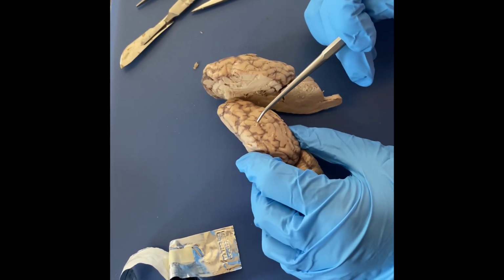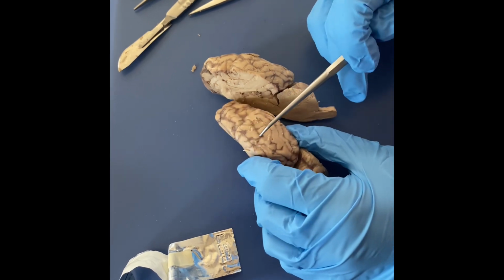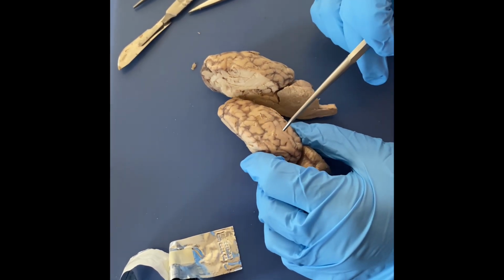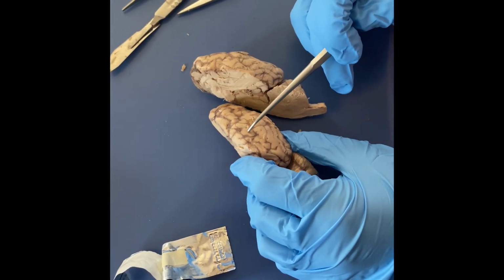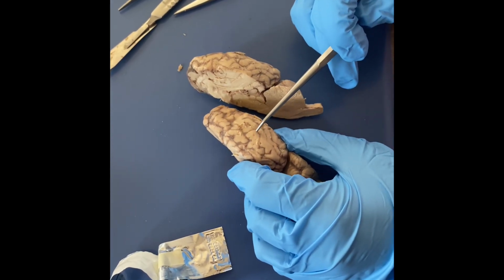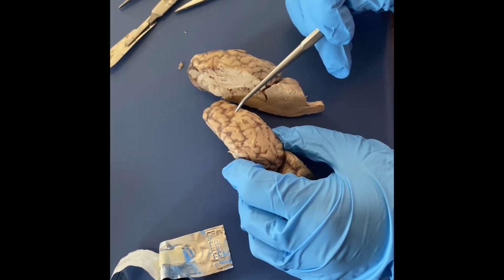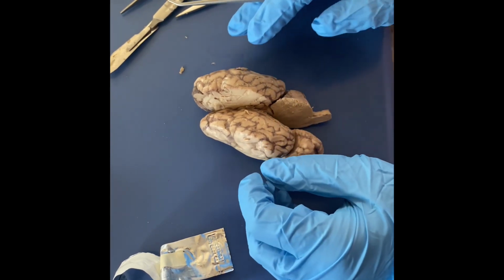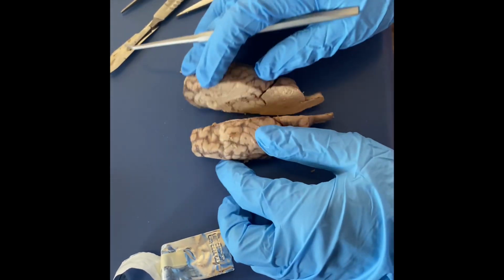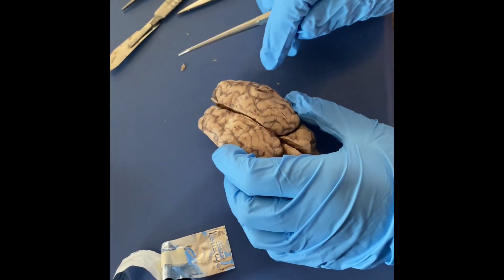So then, if we look on the outer portion of the brain, I also just want to point out that sulcus, those are the lines separating the different parts of the brain right here. And then the gyrus are the actual grooves and chunks in between the lines. So like these. And then just to go back to the cortex, that's the whole outer portion of the brain.